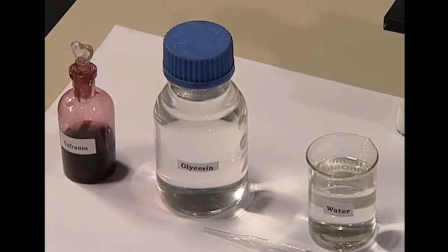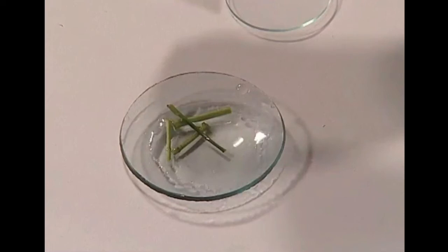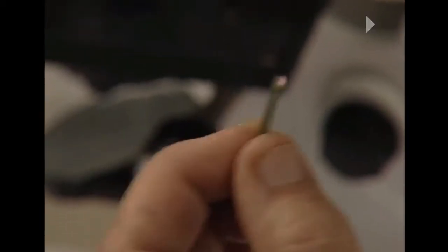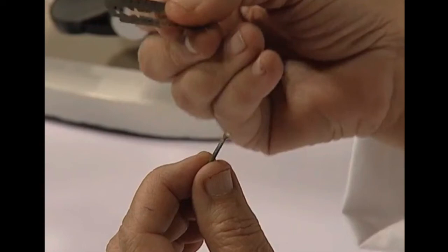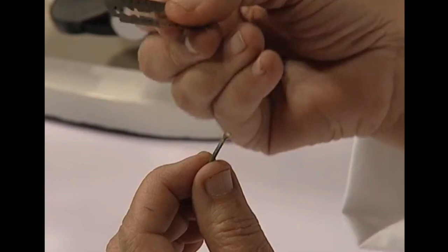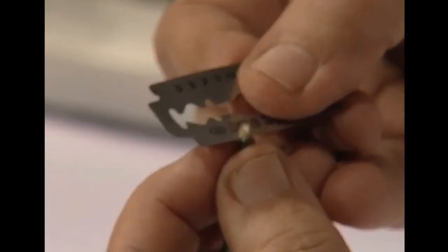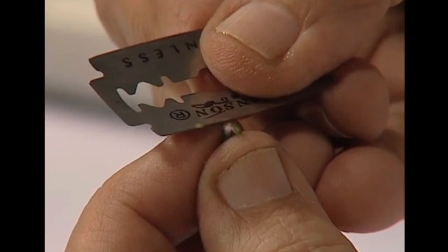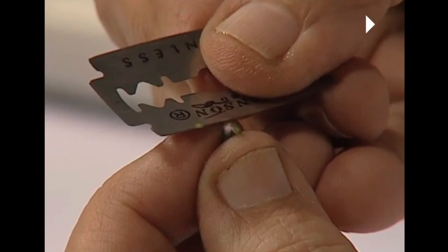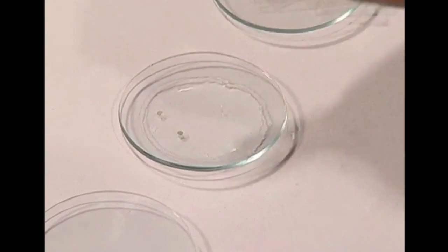After arranging all the materials, take the soft stem cut to two to three centimeters. Hold the stem in your left hand between your fingers so that the stem is vertical, and hold the blade in your right hand so it is horizontal and perpendicular to the stem. Slowly cut very thin sections of the stem — make sure not to cut your fingers. Try to take sections as thin as possible so they become transparent and clearly visible under the microscope, then carefully transfer them into the watch glass containing water.